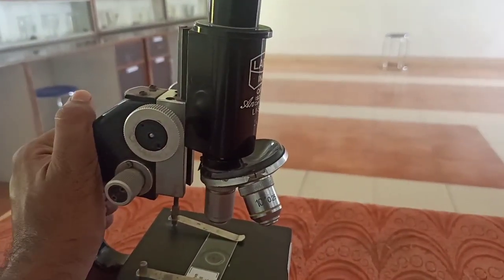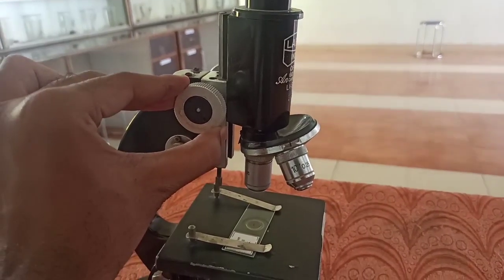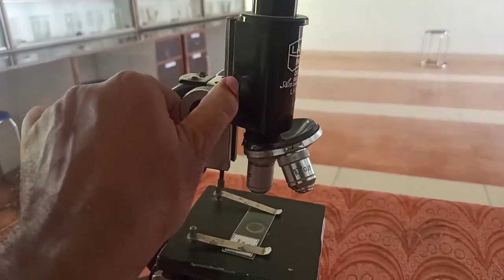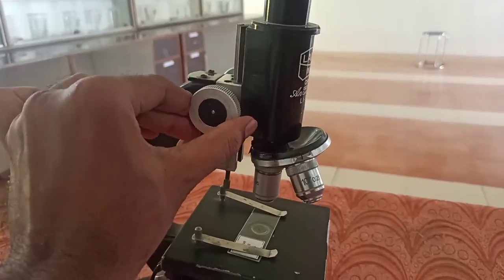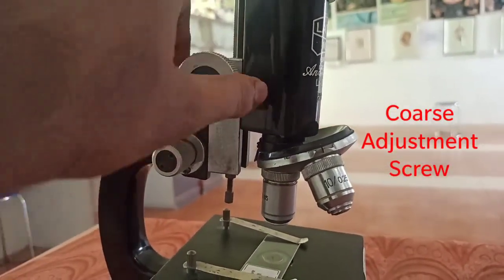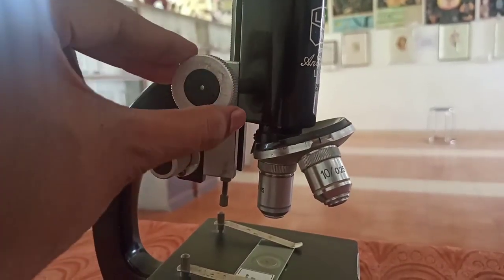How to adjust the microscope, or how to have a good vision? For that, there are two screws. This is the major screw, which is responsible for the major movement of the microscope. Now the tube is going down, as you can see — the body tube. So for major movement, this is responsible. This is called the coarse adjustment screw.